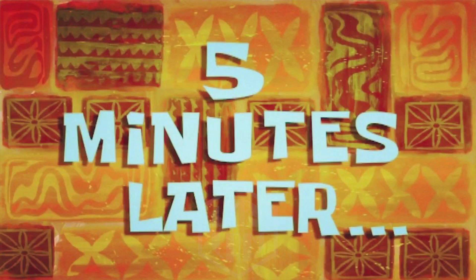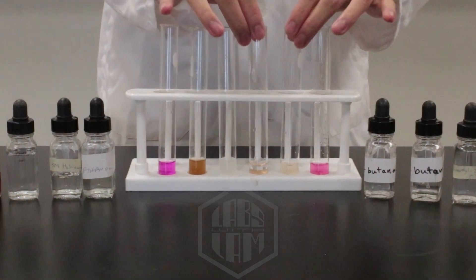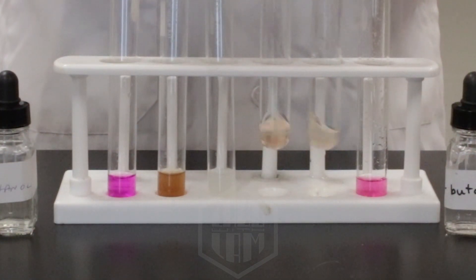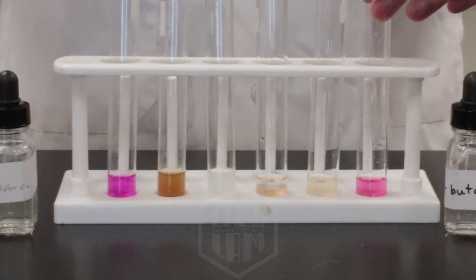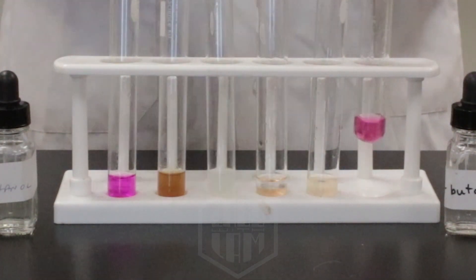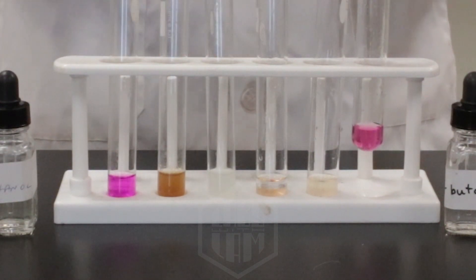Five minutes later. Alright, so now what we can see is that the first two test tubes have more completely reacted, while the last test tube hasn't really changed. So we can go ahead and take our final observations.